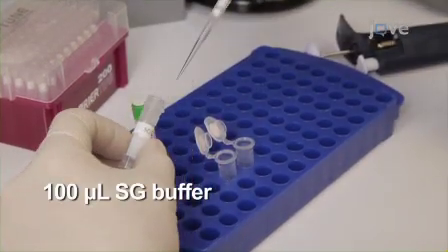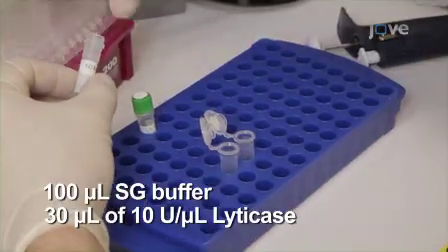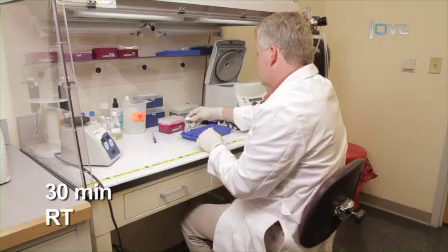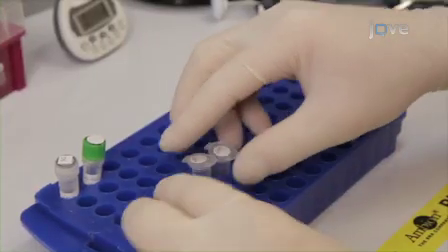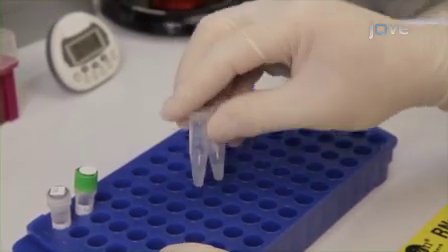Then add 100 microliters of SG buffer and 30 microliters of lyticase solution to the yeast pellet. Vortex to mix. Incubate both tubes for 30 minutes at room temperature. During the incubation, gently swirl each tube every 10 minutes to generate spheroplasts.